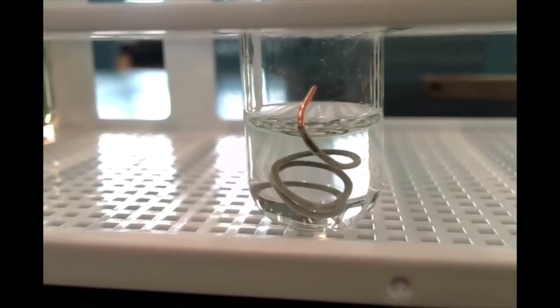So with a little bit of the copper wire sticking out above the silver nitrate solution, you can see what it used to look like. And if you look at it now, you can see that what is underneath obviously looks very different. Okay. The silvery stuff that's sort of growing on our copper wire are actually little flakes of silver metal. Okay, so we're seeing tiny little slivers, tiny little needles of silver metal that's forming on our copper wire.